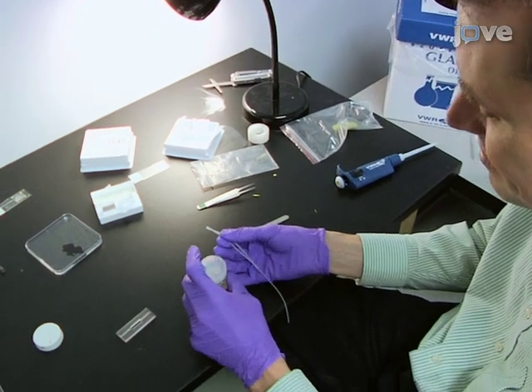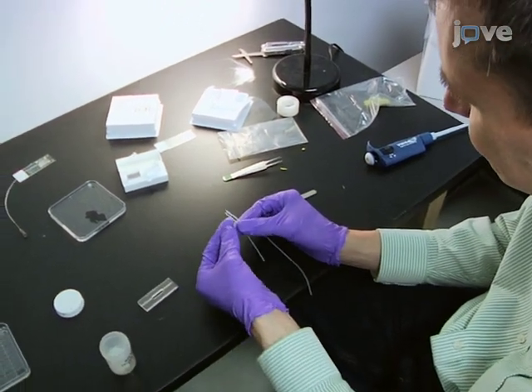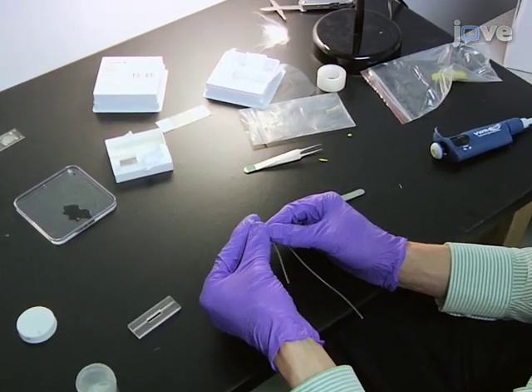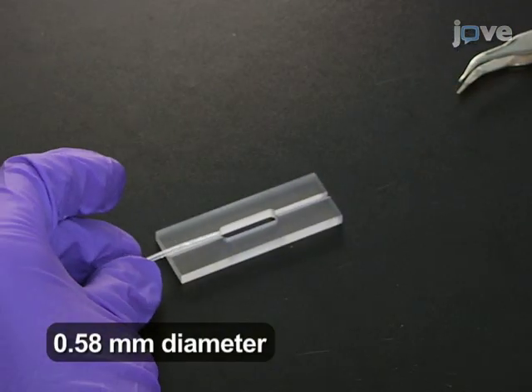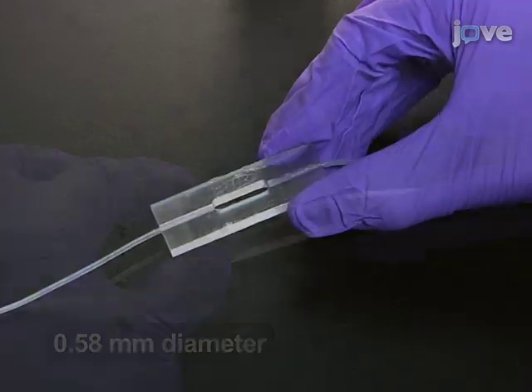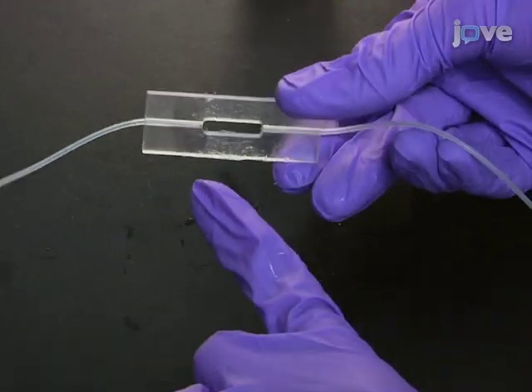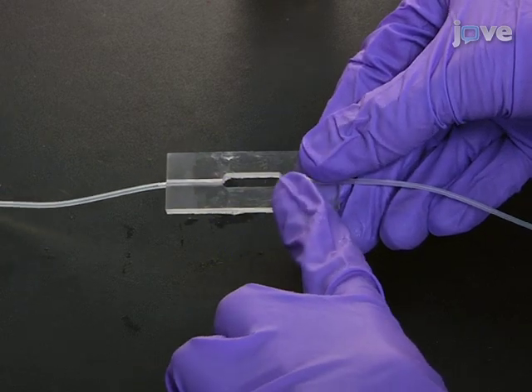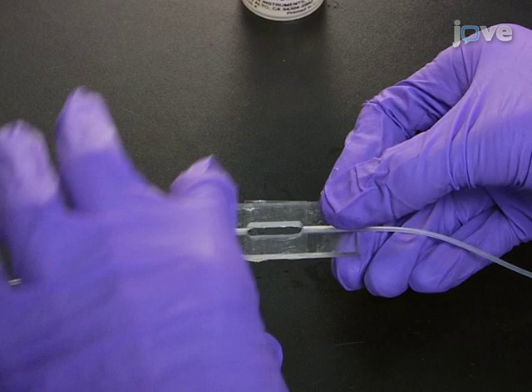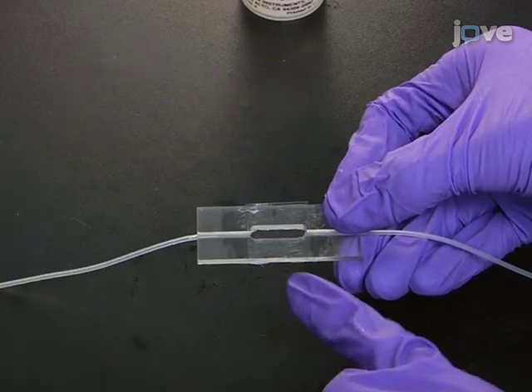To assemble an imaging chamber with a plexiglass chamber, spread a thin layer of silicone grease around 2 polyethylene tubes and press the coated tubes into the channels on each side of the plexiglass chamber. Then, spread a thin layer of silicone grease on the surface of the chamber that contains the tube grooves, and place a cover slip onto the grease to seal one side of the chamber opening.